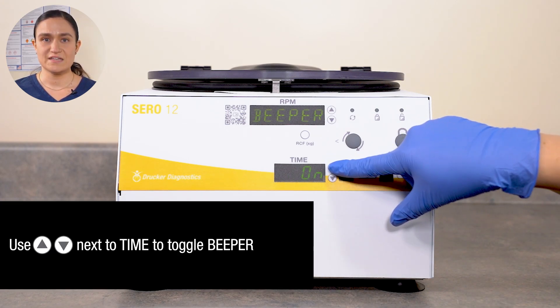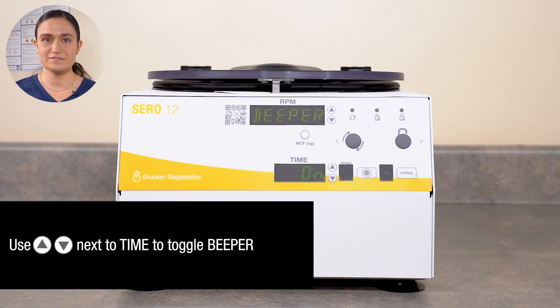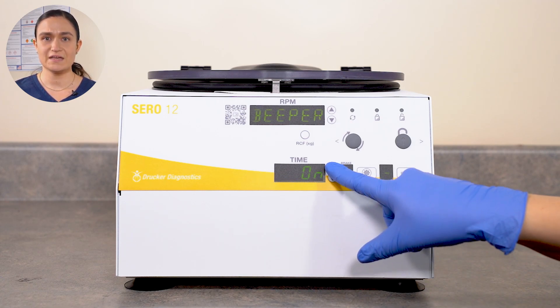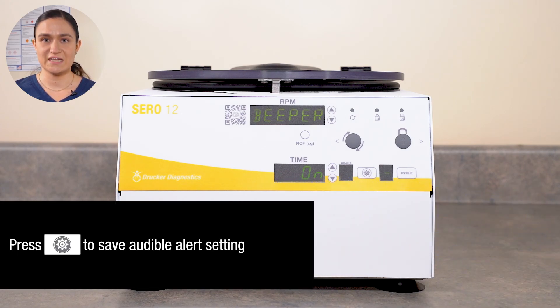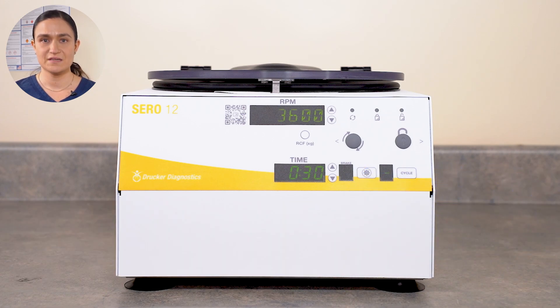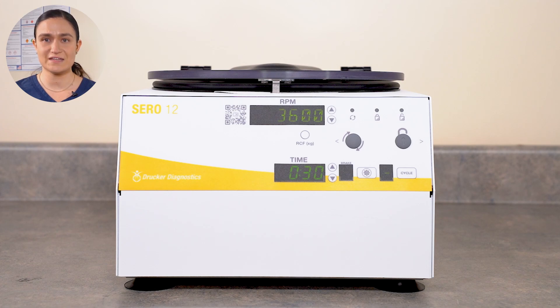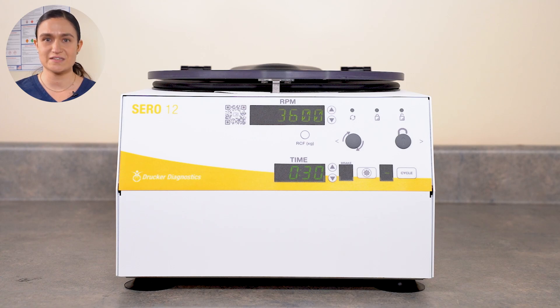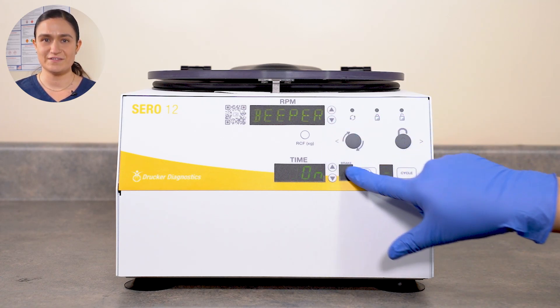Use the up and down arrow buttons next to the time screen to toggle the audible alert setting on or off. The time screen will show the status on or off and update dynamically as you adjust it. Once your audible alert setting is as desired, press the menu button to exit the menu. The centrifuge will run with the selected audible alert setting until that setting is changed. Since it's a toggle, switch it back using the same process we just discussed, but make sure it's on or off as desired.